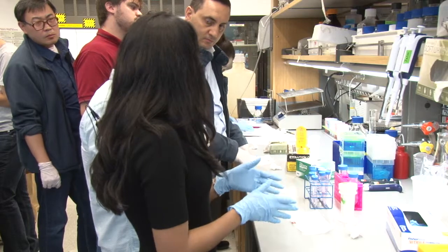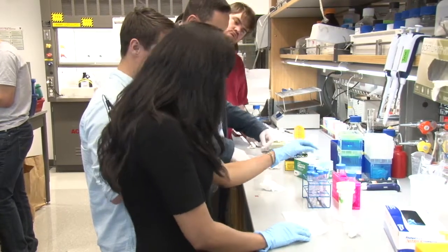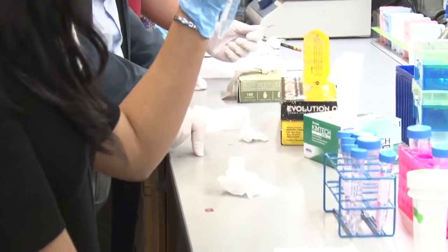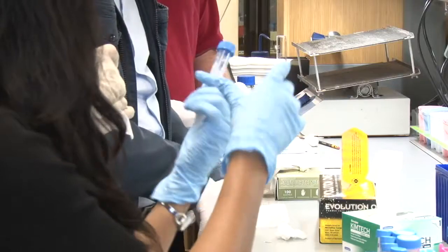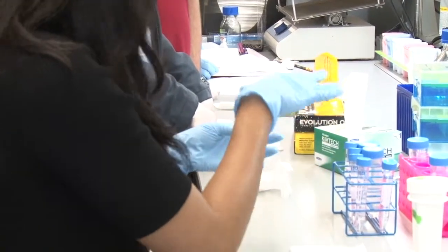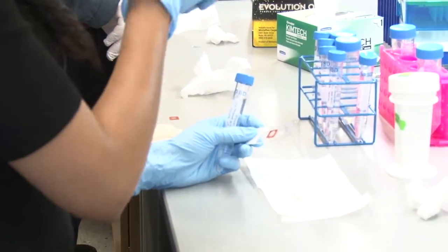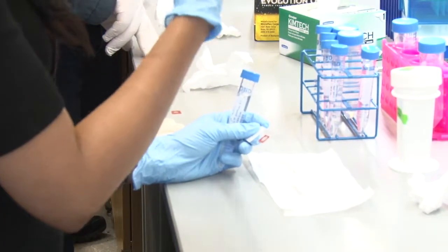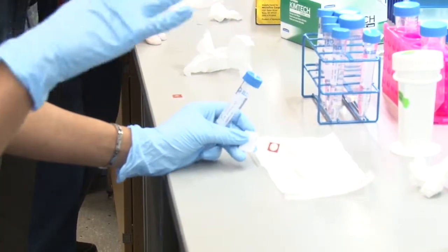The next step is to add the hybridization probes. I have some probes dissolved in hybridization buffer. You can try adding into these ports just to get a feel for how it is to use these. A couple of things to make sure: always add from one port and remove from the other so that things get washed out more evenly. If you're beginning to use this, there is a possibility you might face bubbles or chambers that are not completely immersed in solution.